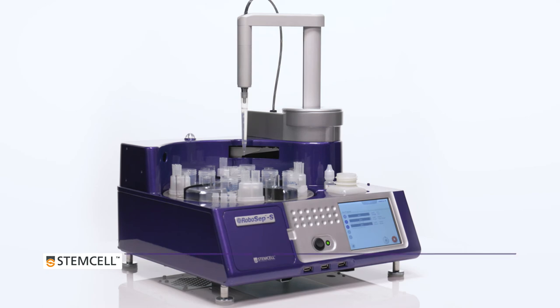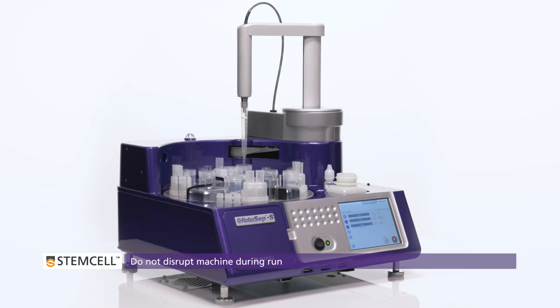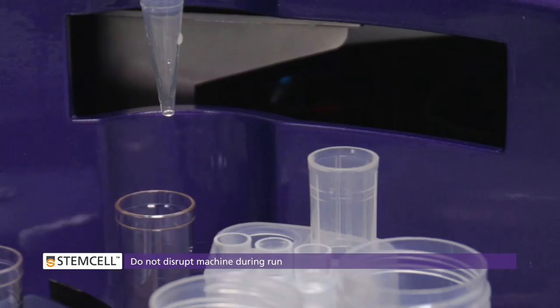In order to avoid disrupting the positional calibration of RoboSep's carousel and arm, do not touch any mobile parts while the unit is running.